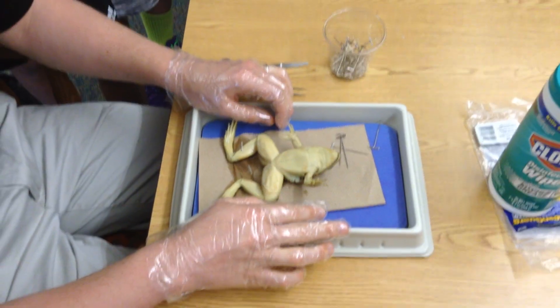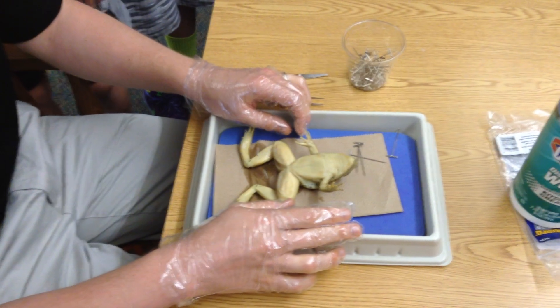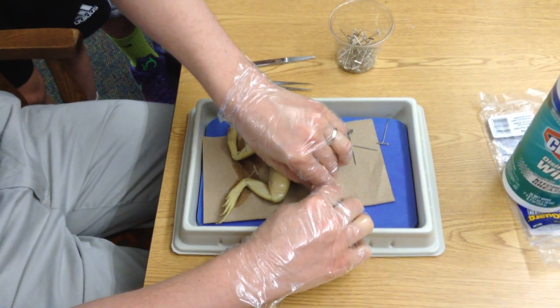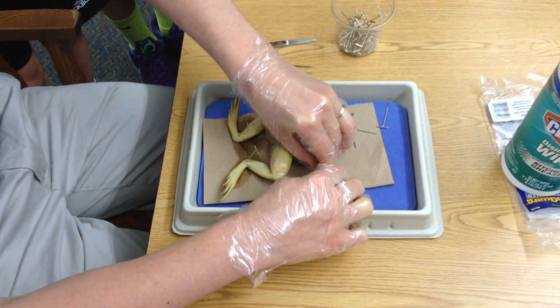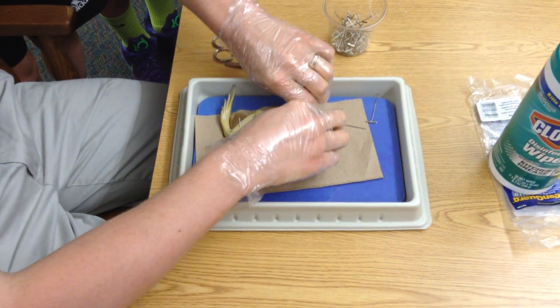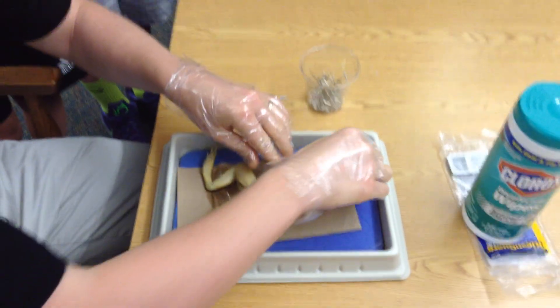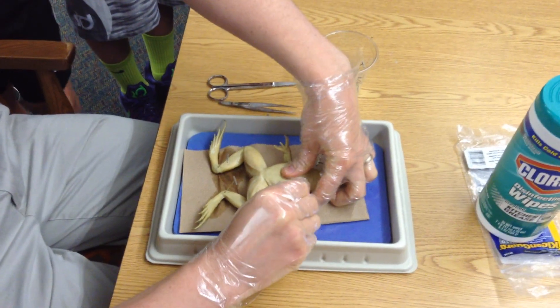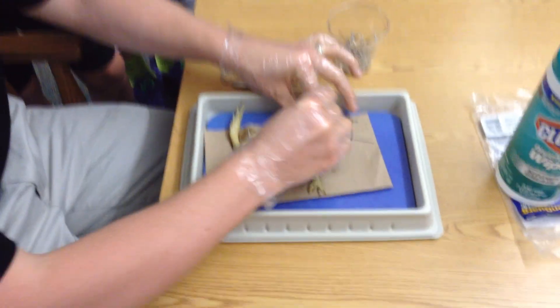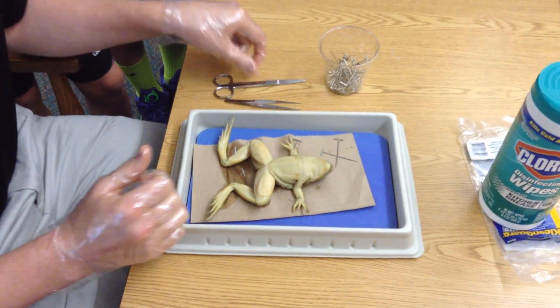The fun part. Vargas says cut them — not necessarily cut it. Any other ideas? Jayden: you'd be like popping them out of the socket? Yes — you'd have to break the arms. So if you're super quiet, maybe you'll hear it. That one didn't make any noise — that's lame. Let's try this one. A little bit. Just a little bit. Then pin the arms back, because once they're broken, the arms will tend to stick back a little bit better than they would have otherwise.